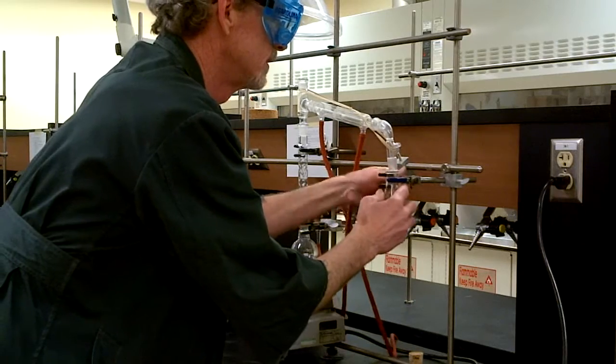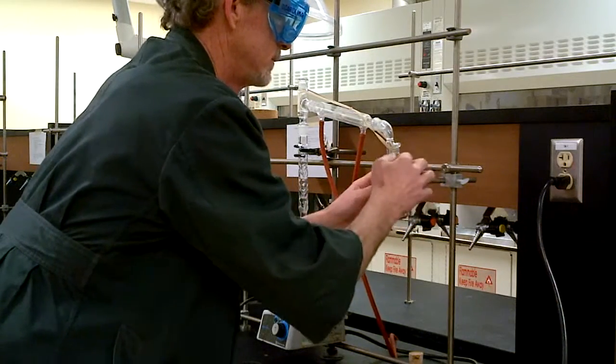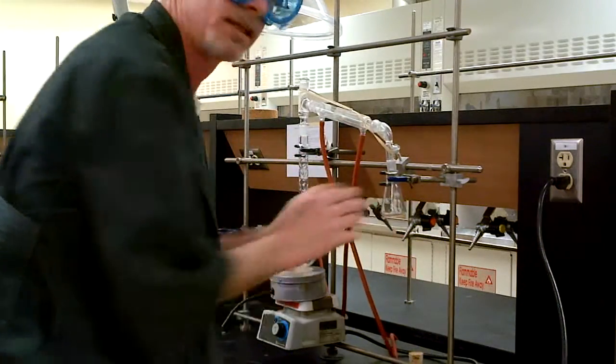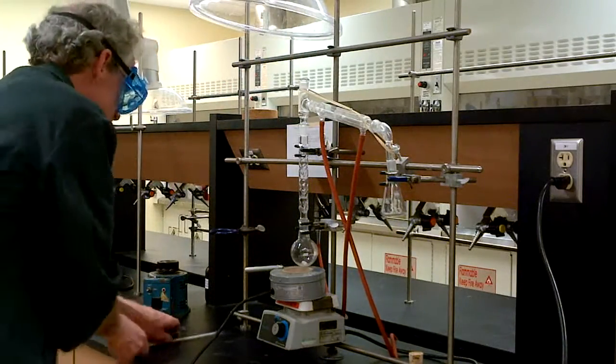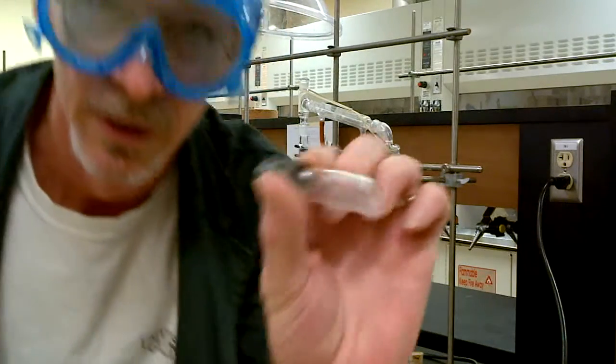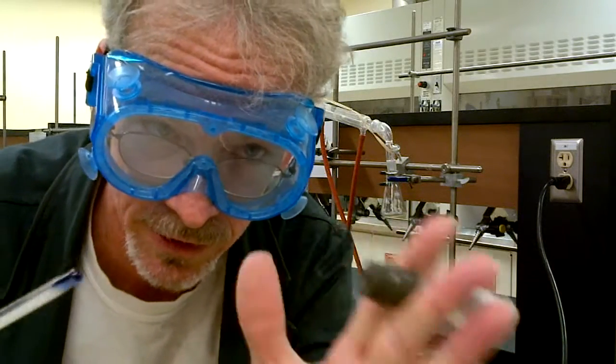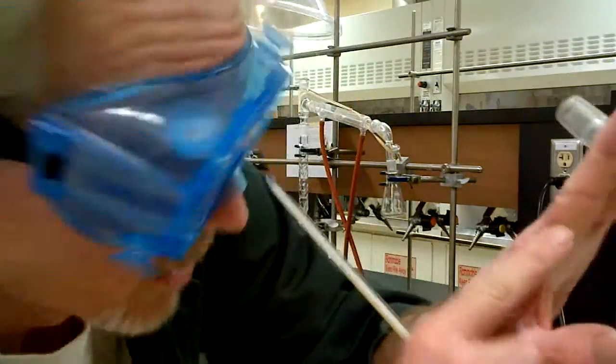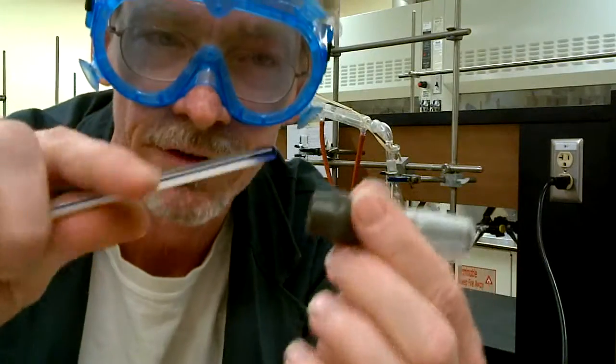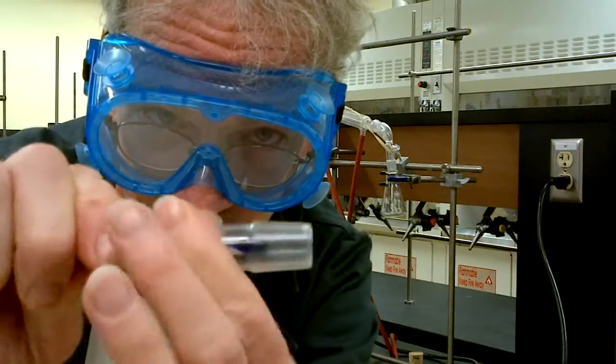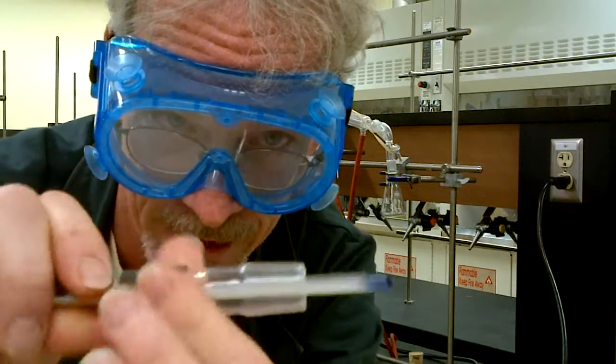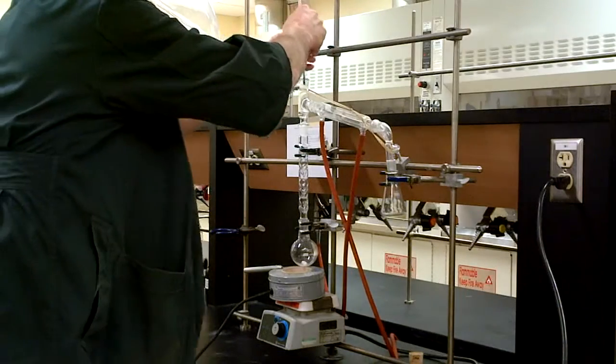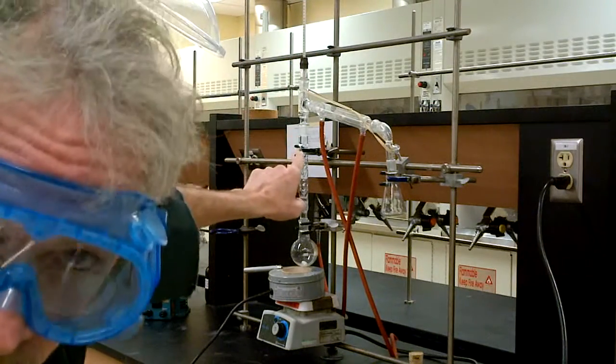We also require a thermometer adapter and a thermometer. Now this is very tricky. If you do this wrong you will break the thermometer and drive it into your hand and get scars kind of like this one and this one. So very carefully, holding it close together, you push it in. No harm, no foul.